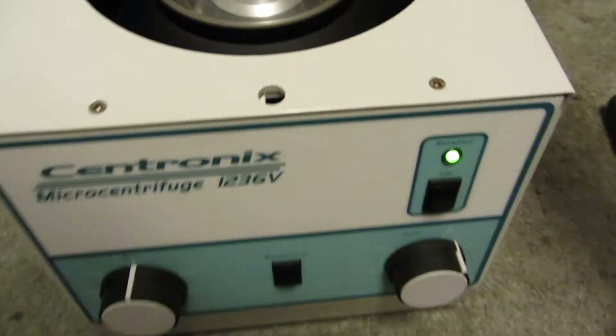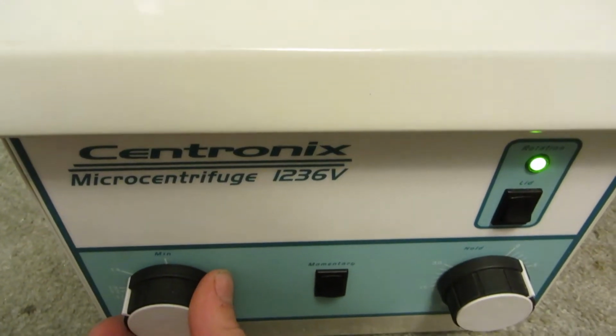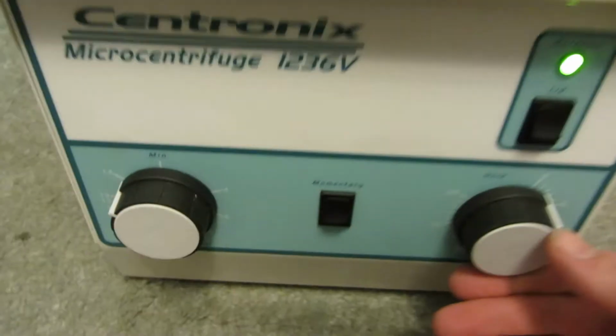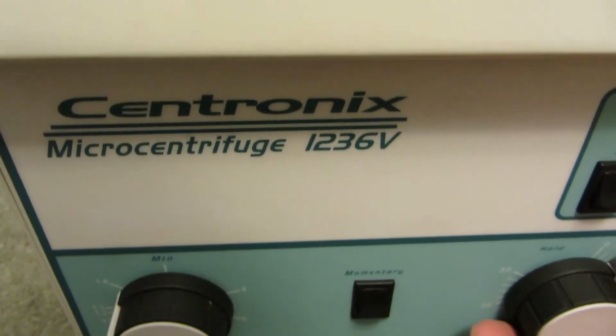I'll do that again, except I'll have the lid closed. Maximum speed. It has an electronic braking system. So when I advance the timer to 0, you can actually kind of hear the braking engage. Just take note at how quickly that decelerates.